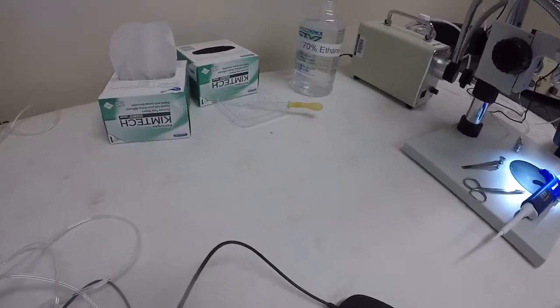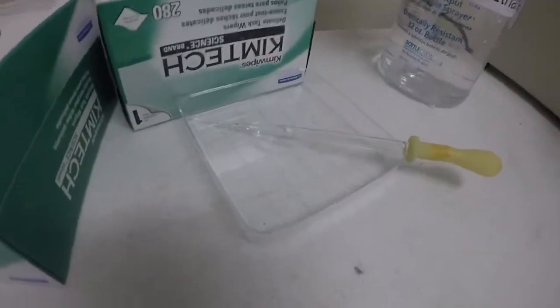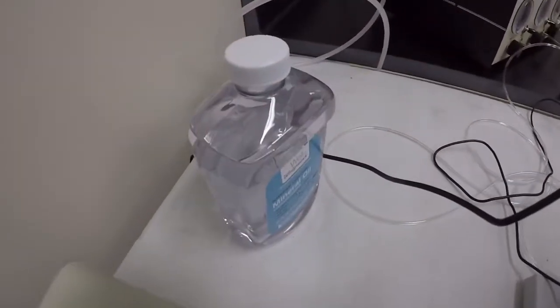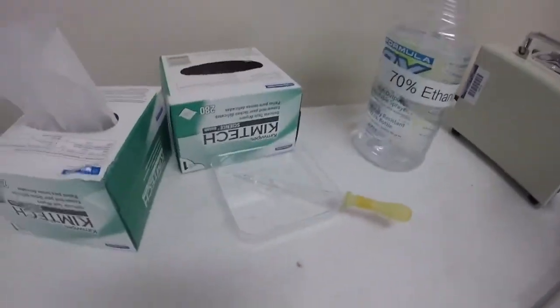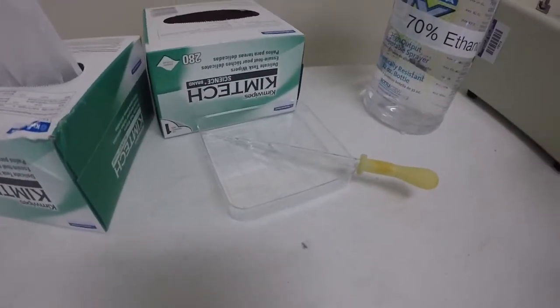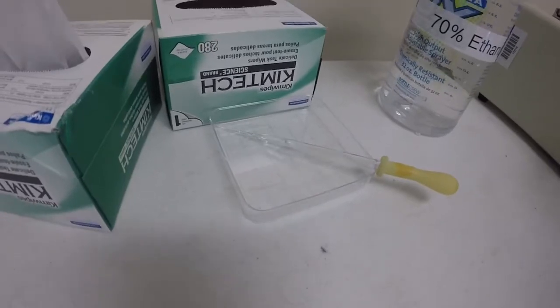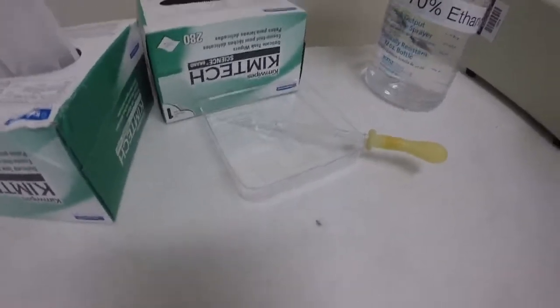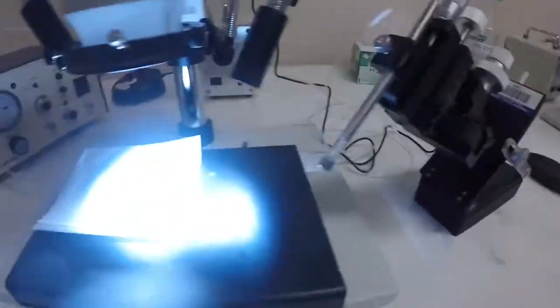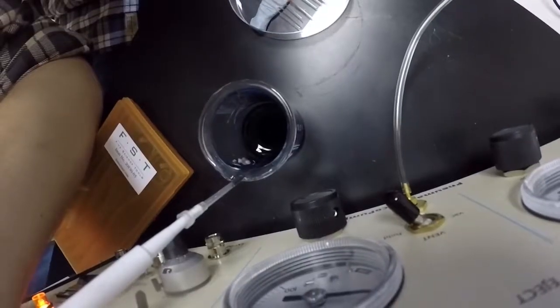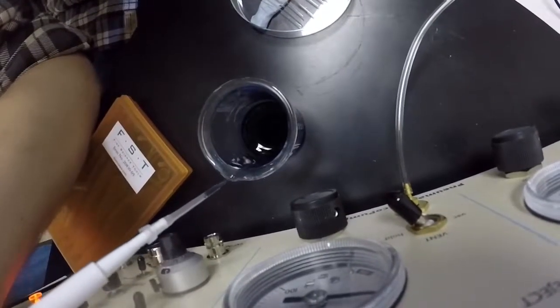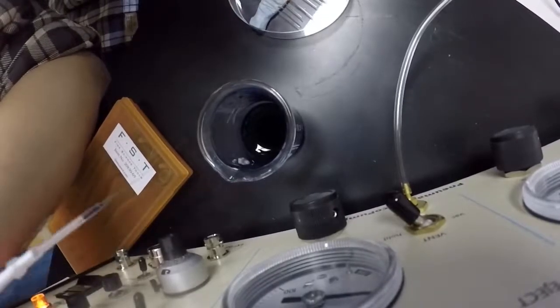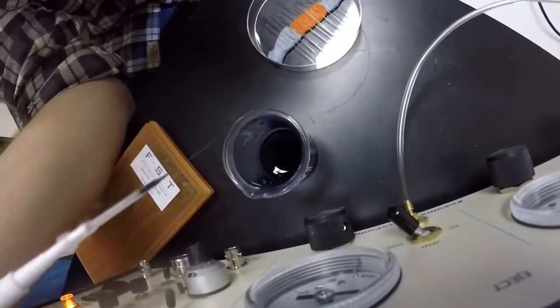By chance, there's a lot of mineral oil in there. If you need more mineral oil, we have a bottle of it right here. But it's super messy and it's just kind of a hassle. So if you can avoid messing around too much with that, that's always good. Just be sure to clean up after yourself when you're done.